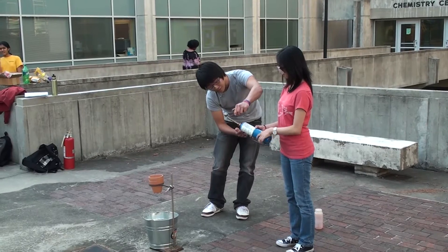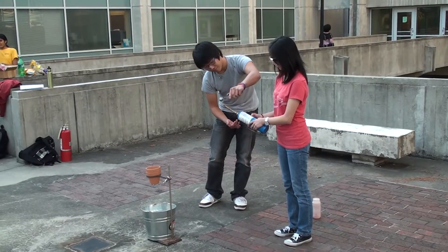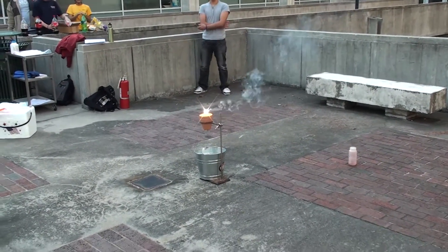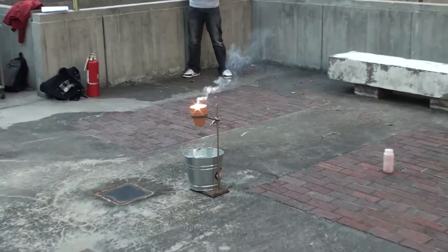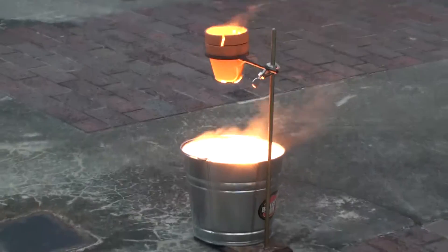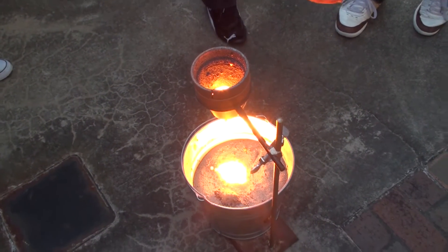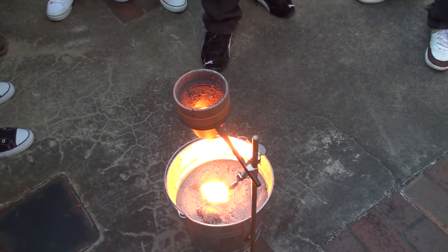It's caught on fire. Lighting the torch. You can come up closer if you want now to look in. If you are relatively nearby, you can actually feel the heat being emitted. If you want to feel the heat, use the back of your hand. It's really hot — don't get too close to it. And that's the molten iron. That's thermite.